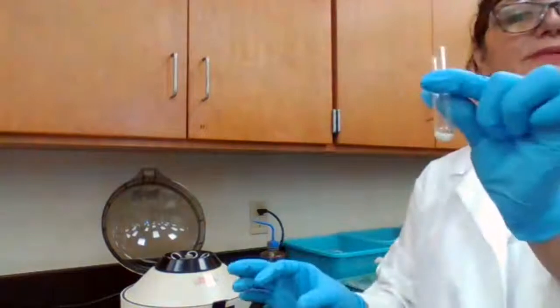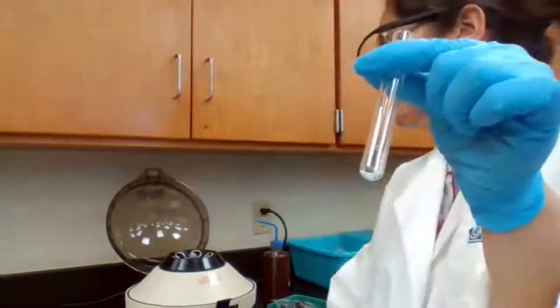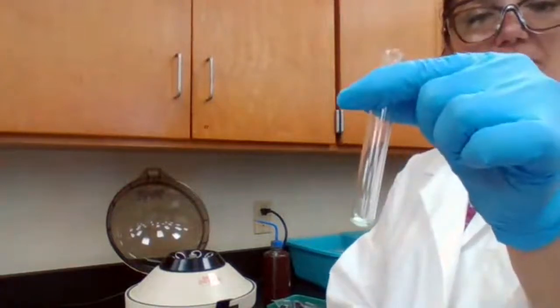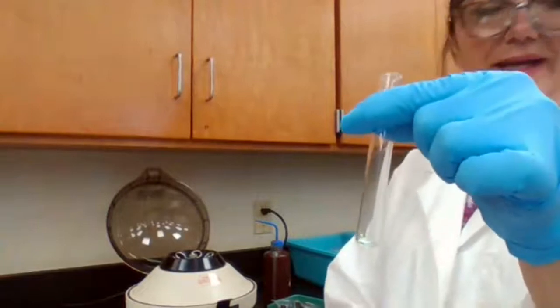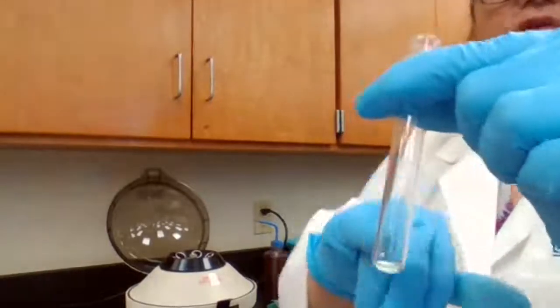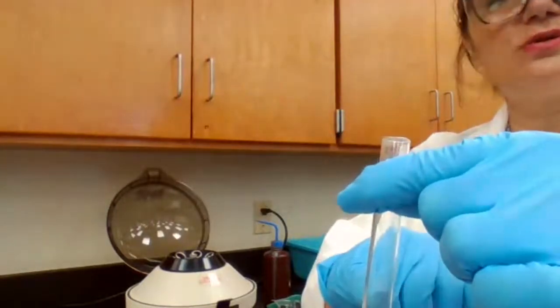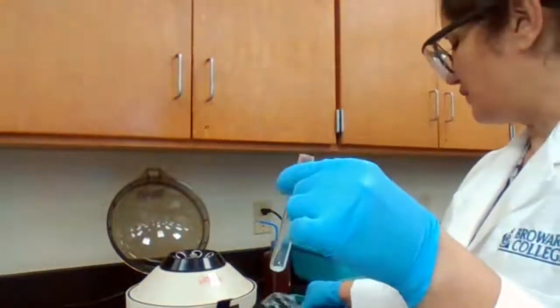The test tube with the precipitate is going to be tested for part B, which is separation of lead chloride from silver chloride. And hopefully you know it already, how to separate lead chloride from silver chloride. Both of them are solid at room temperature, but when you hot water, lead chloride goes into solution, silver chloride will stay in the precipitate form.